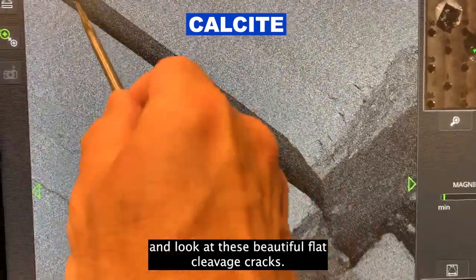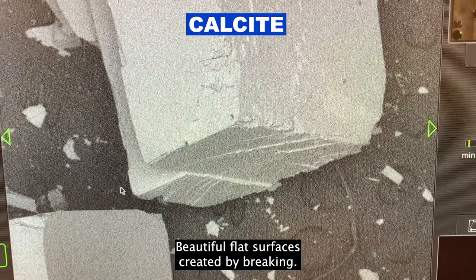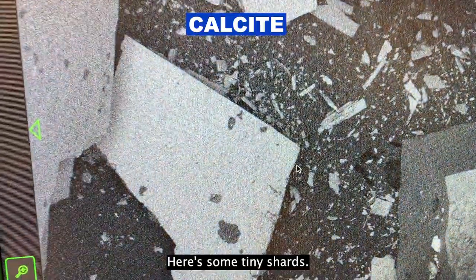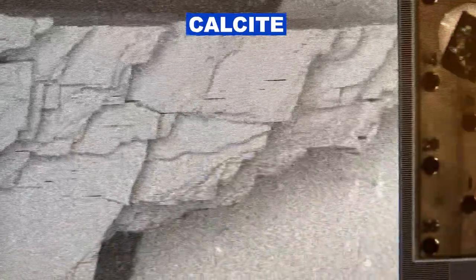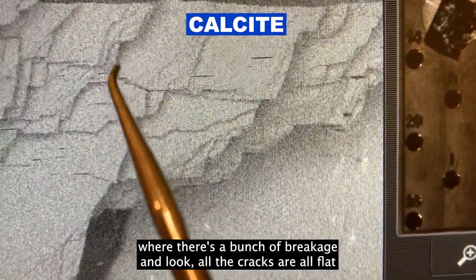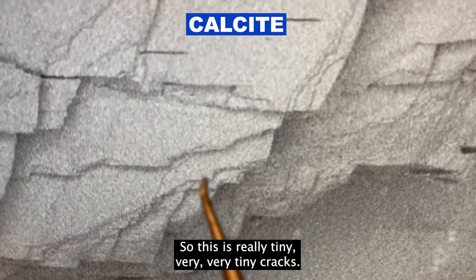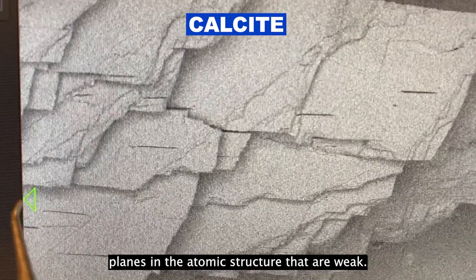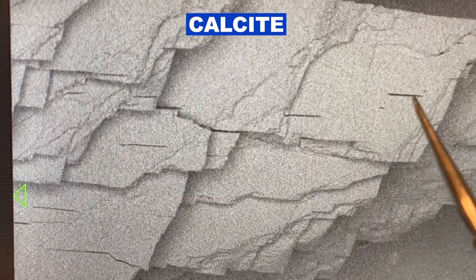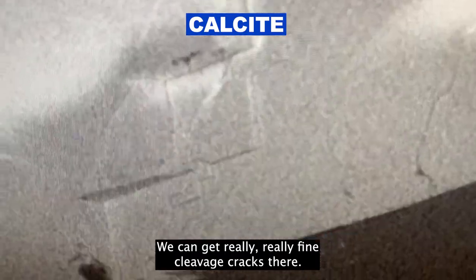Now let's look at our calcite and look at these beautiful flat cleavage cracks. Here's another example — beautiful flat surfaces created by breaking. Here are some tiny shards, just tens to maybe a hundred microns wide, and all the little shards have the same flat surfaces. Here's an area where there's a bunch of breakage, and look — all the cracks are flat. This is a scale of about a hundred microns — very, very tiny cracks. These straight cracks are created by planes in the atomic structure that are weak. Zooming in to just a few tens of microns, we can see really fine cleavage cracks.